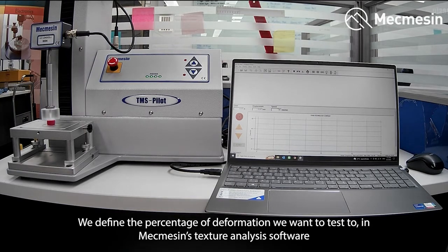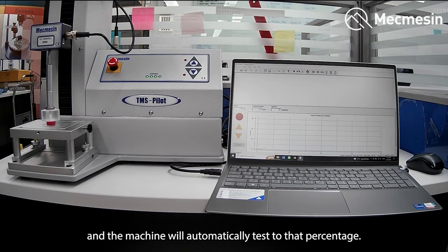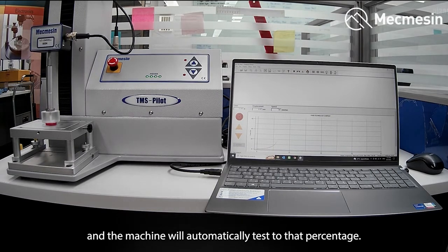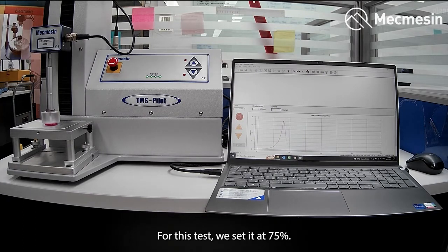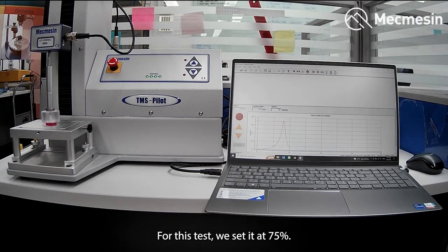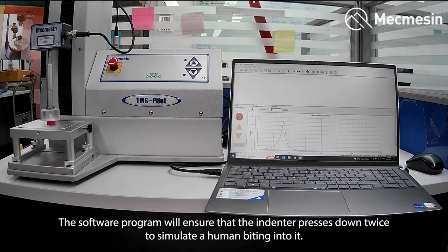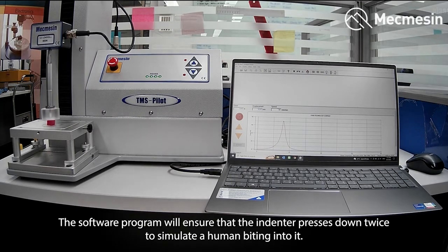The machine will automatically test to that percentage. For this test we set it at 75 percent. The software program will ensure that the indenter presses down twice.